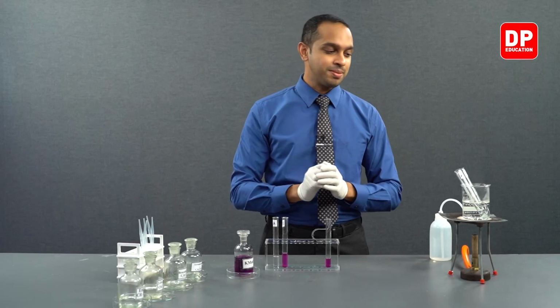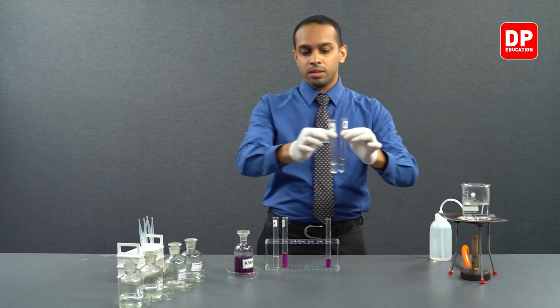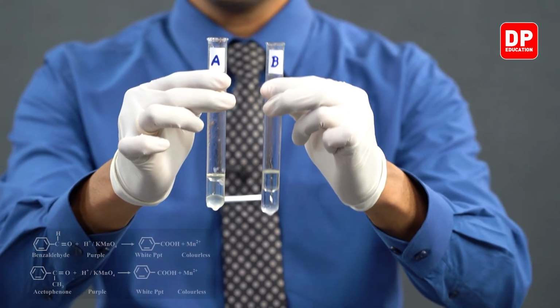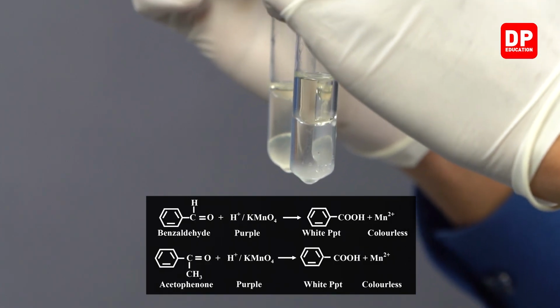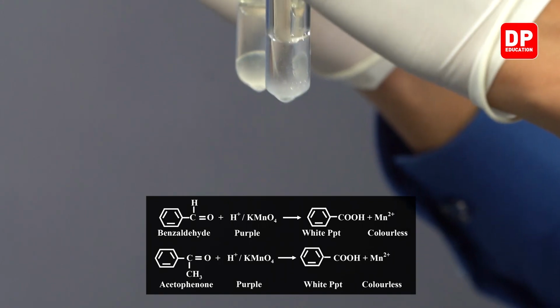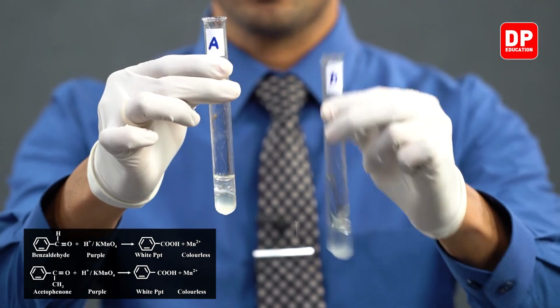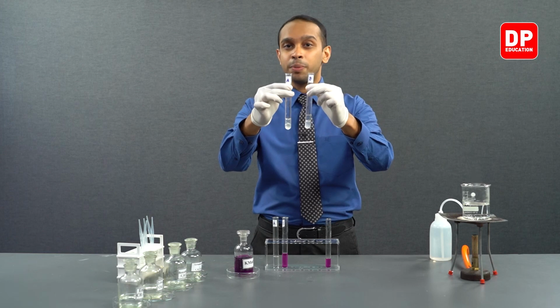Students, we have allowed the two test tubes to heat up in a water bath for a while now. Let's take them out to see the observations. So in both of these test tubes, we no longer see the color of acidified potassium permanganate. We do not see the purple color that we saw earlier after we heated them for a while. We still can see a layer separation in both of the test tubes. However, we do not see the purple color.